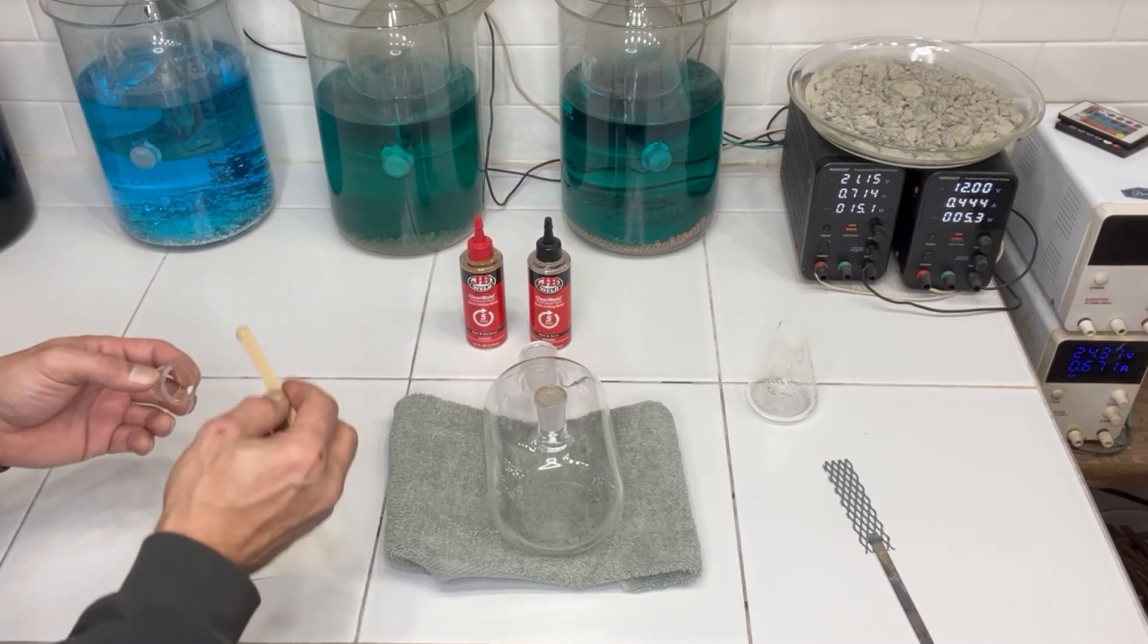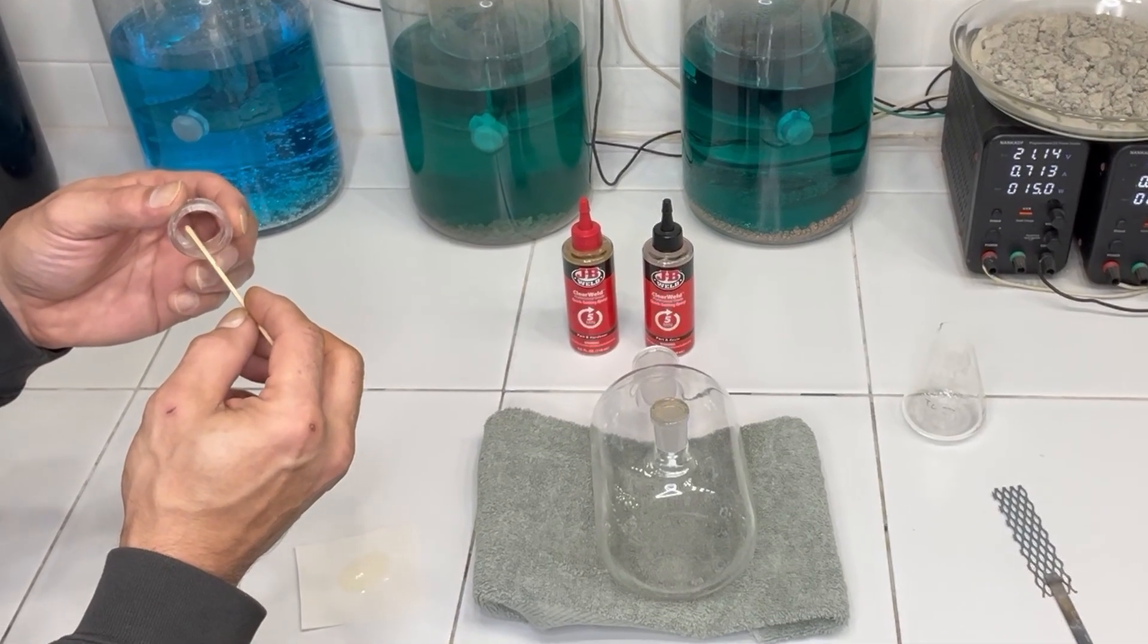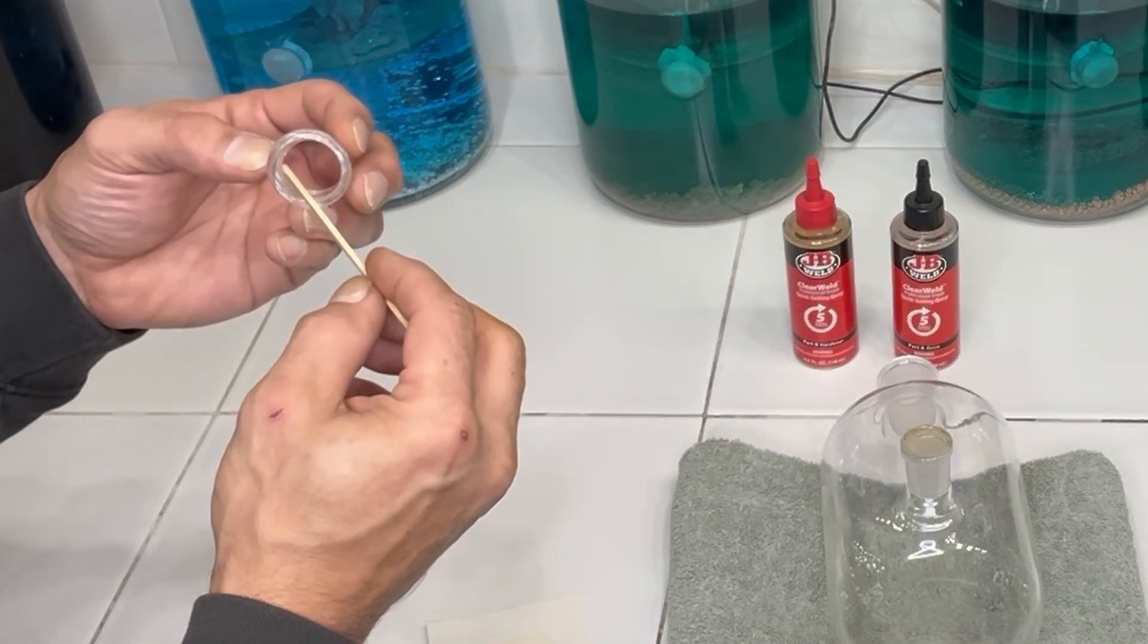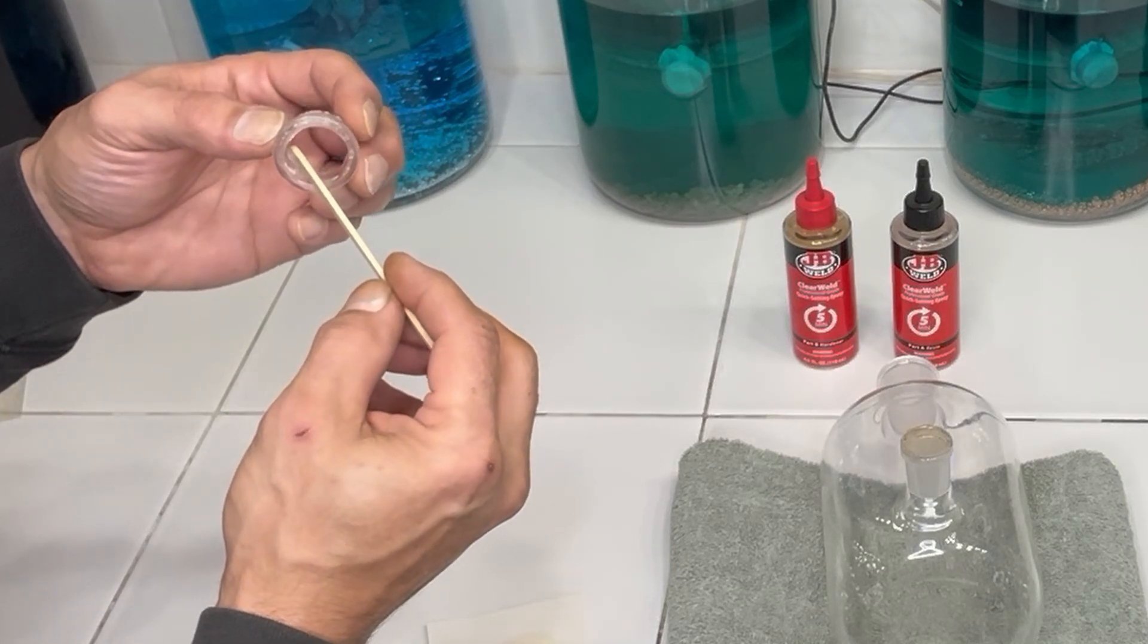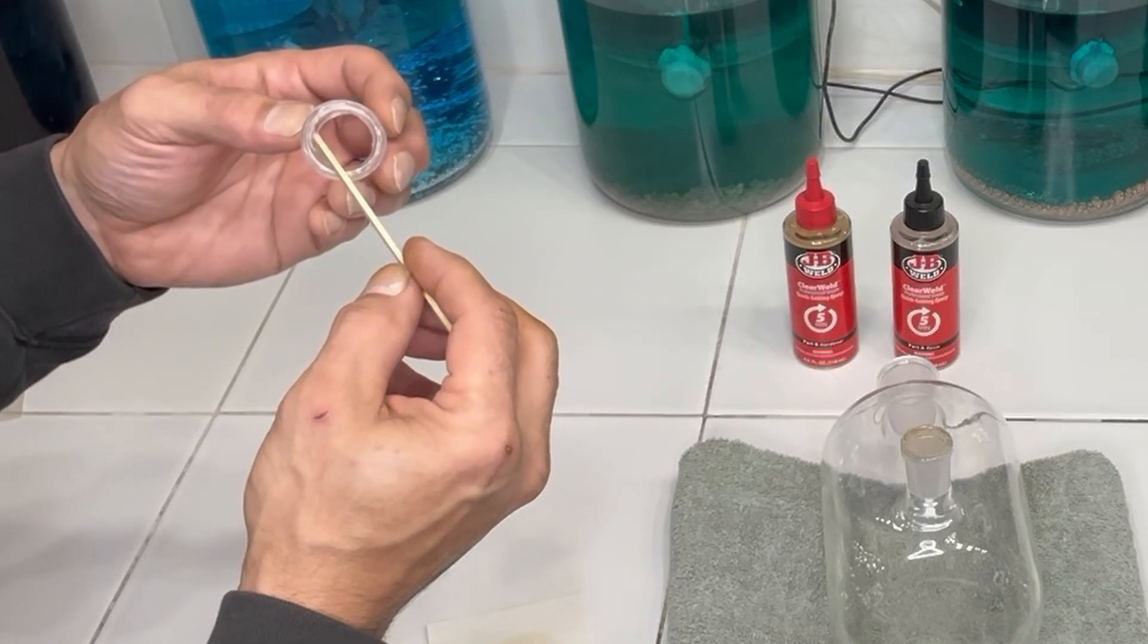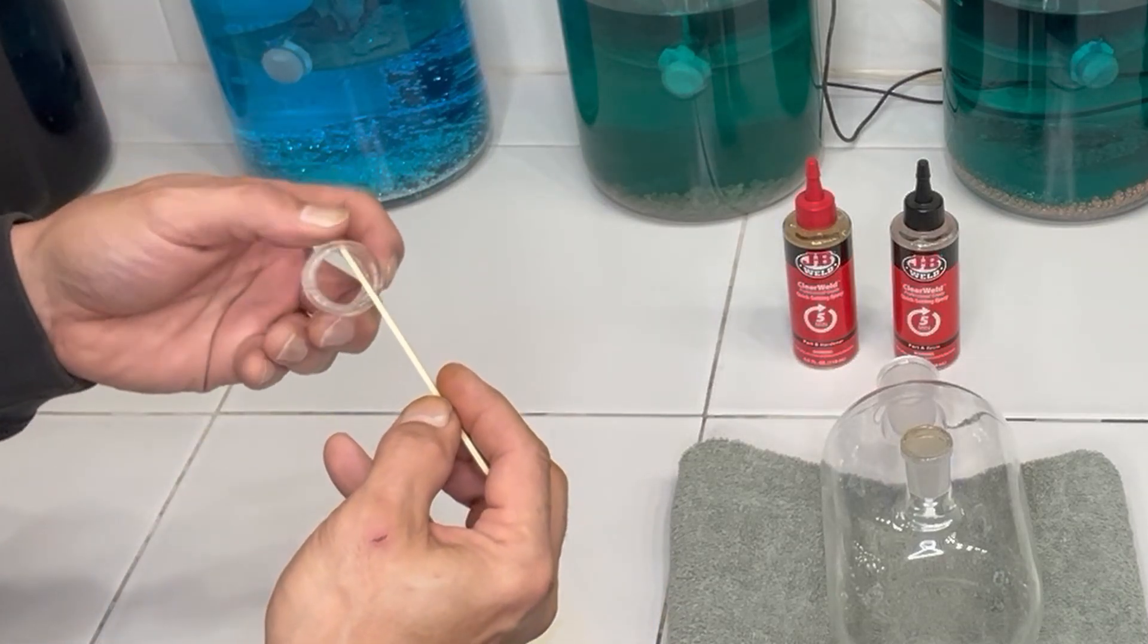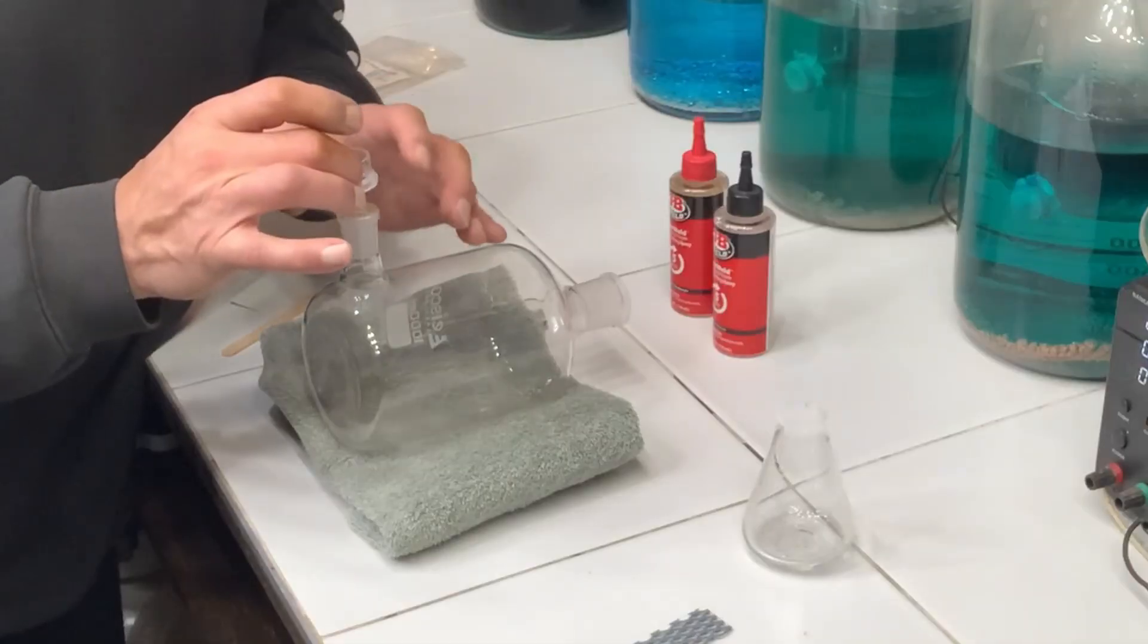Now that that's had a few minutes to dry, about 15 minutes, I've trimmed off the excess. And don't try and fold it over, I made the mistake of doing that on the first attempt here, and the membrane wants to kind of wrinkle on you. Now I'm just going to run a bead right along this inside edge of this glass collar that we cut.